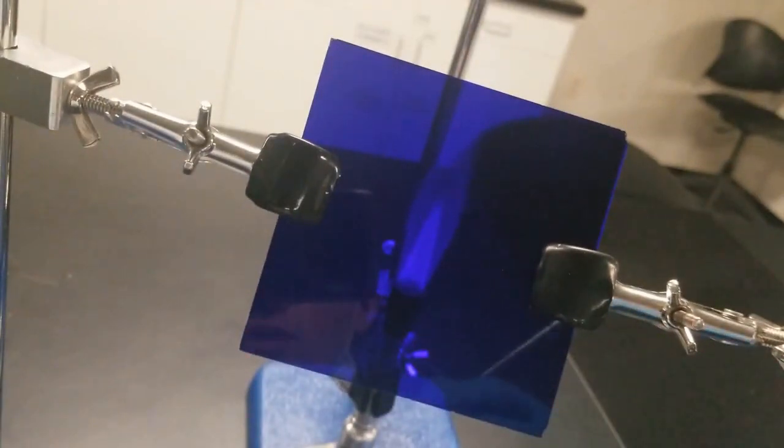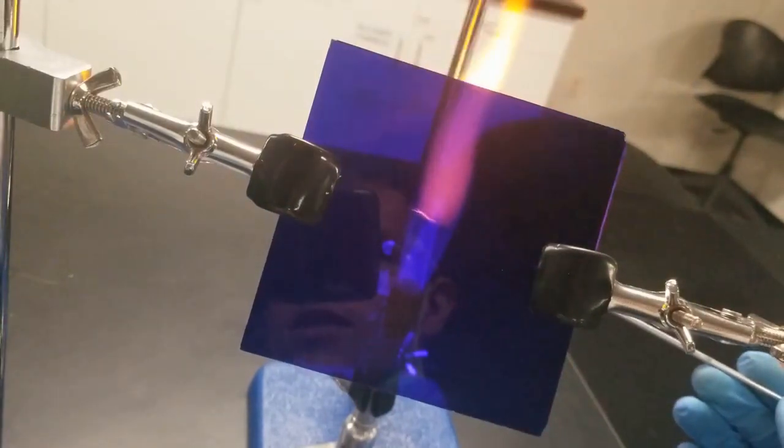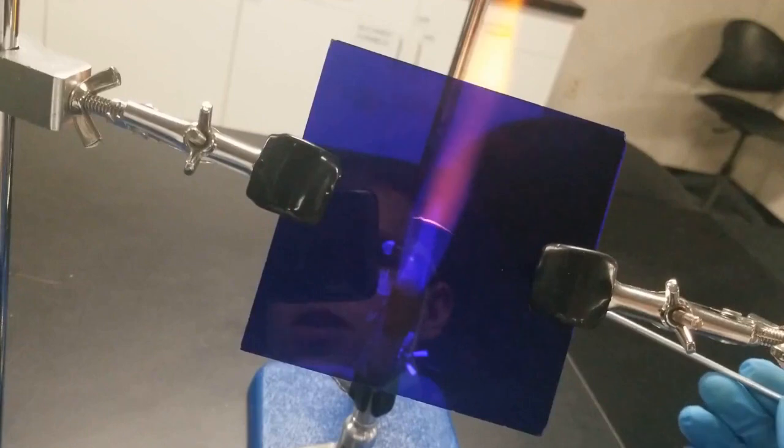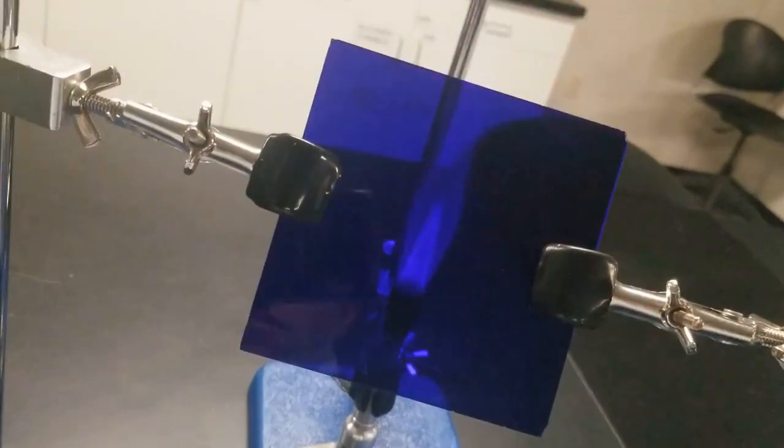So I've got some HCl right here. Dip the inoculating loop into there, and then put it back in. You can see it's still pretty lavender, so I'm going to have to go through this wash cycle quite a few times to get it to wash completely.